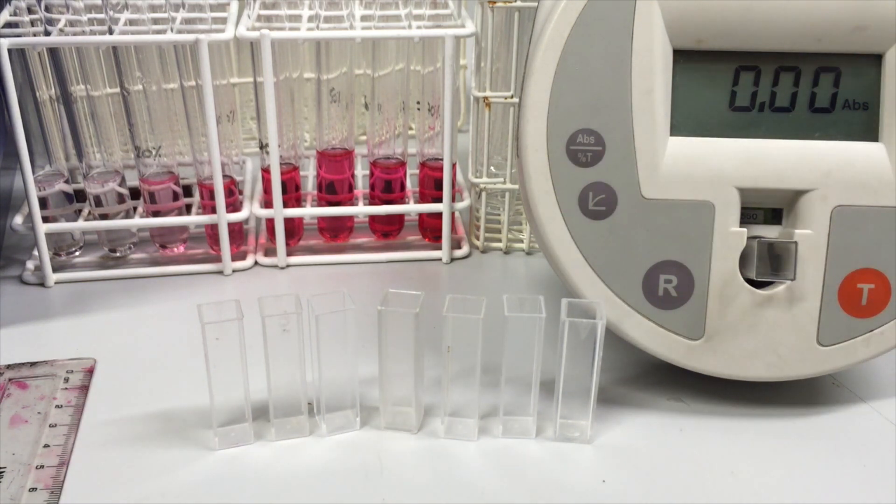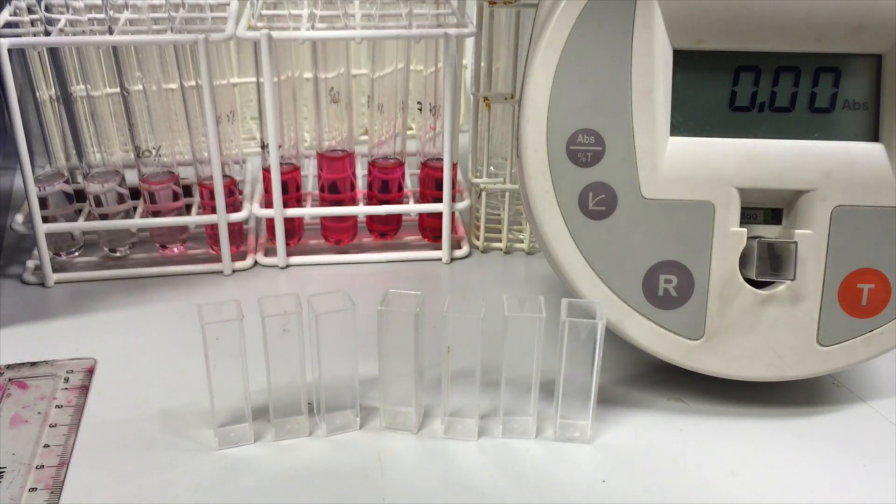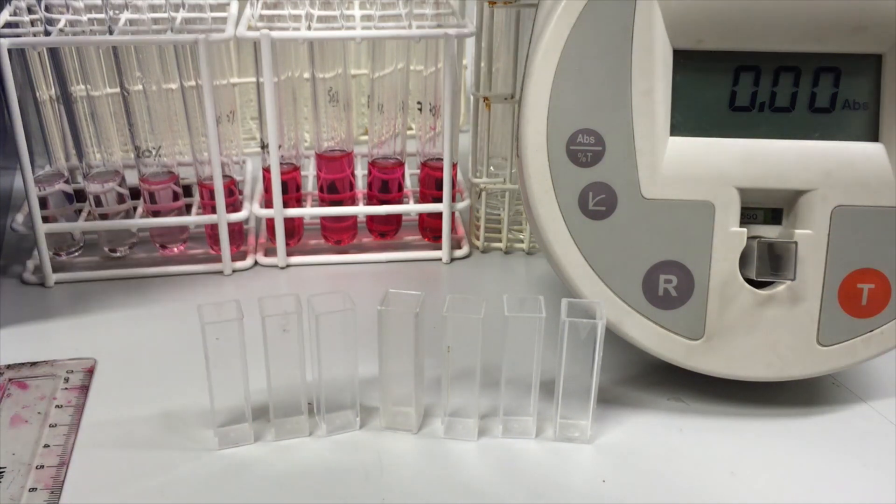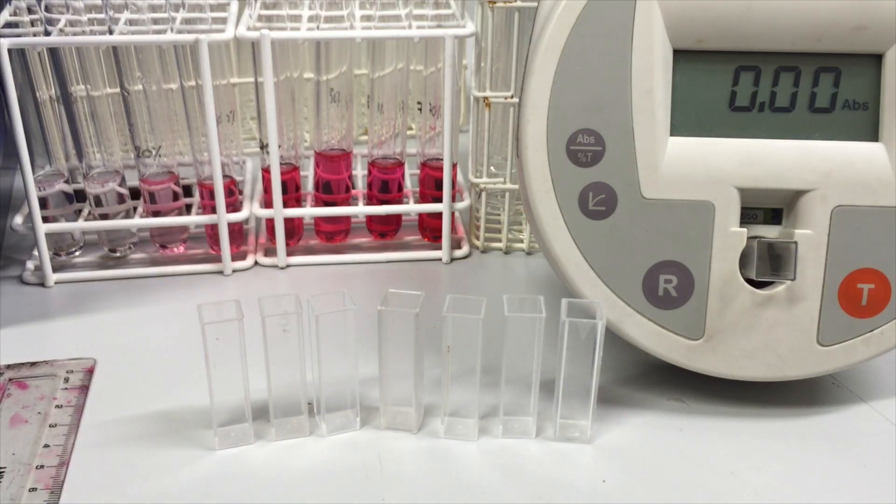And so what we're going to be looking at is absorbance of a particular wavelength. Now, our solutions are pink to red and therefore they're going to be absorbing more strongly in the green to blue region of the visible spectrum. So accordingly, we put that filter in there. So we're really only looking at absorbance of that light.